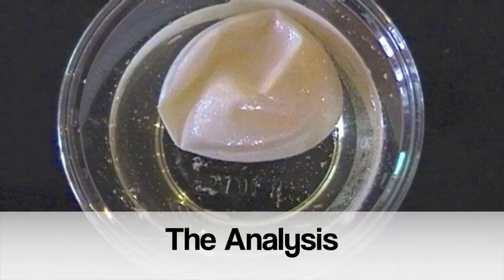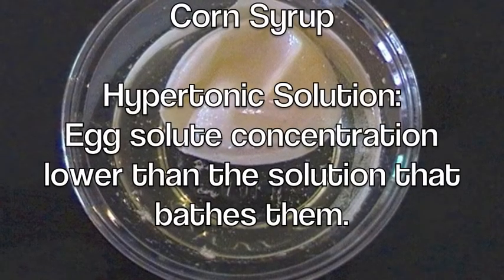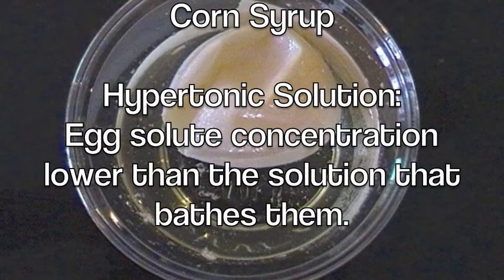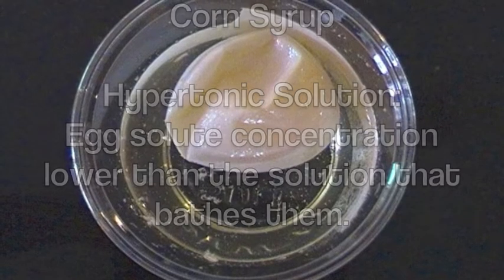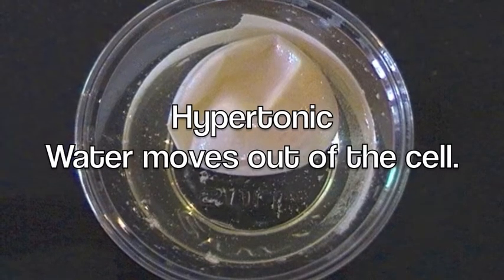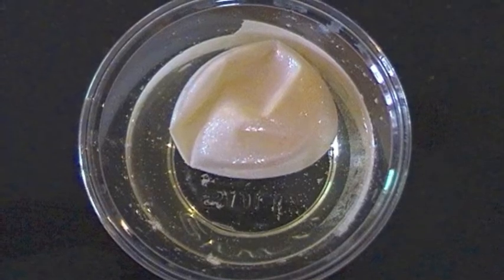In our lab, we found that the egg in corn syrup lost mass or shrunk. This indicates that water moved out of the cell and into the surrounding environment. This egg was in a hypertonic solution. Remember, cells in a hypertonic solution have solute concentrations lower than the solution that bathes them. Another example of a hypertonic solution would be a cell in salt water.